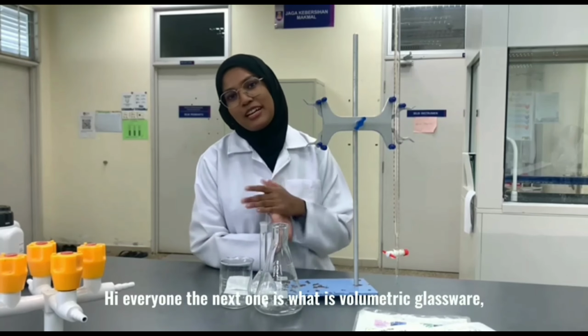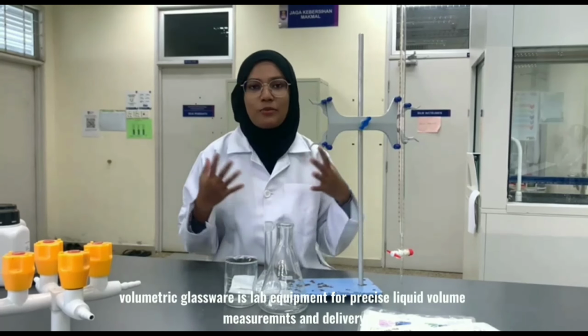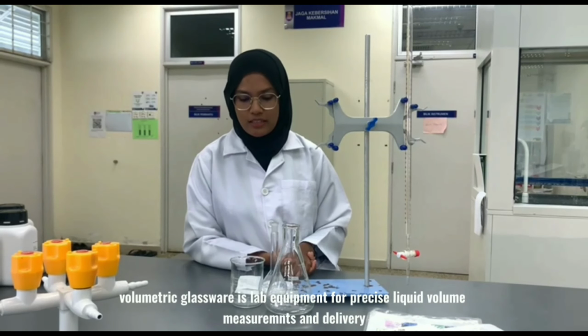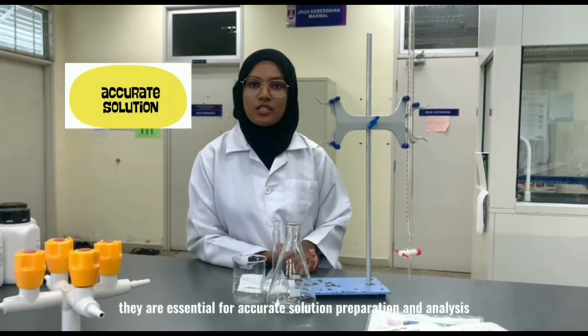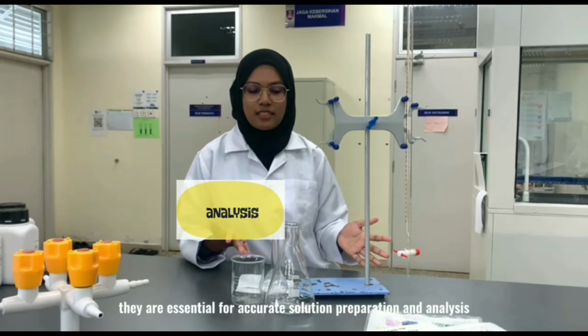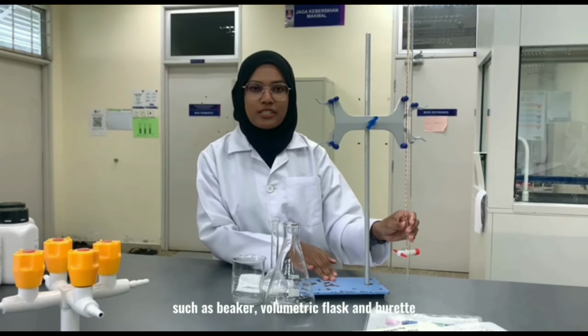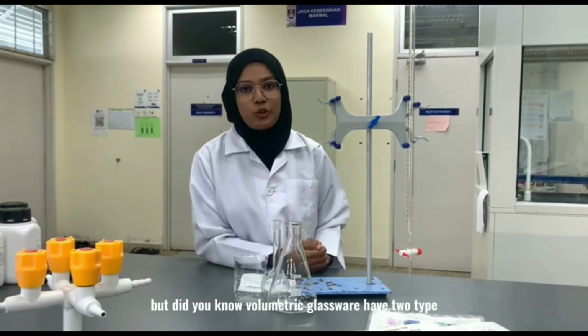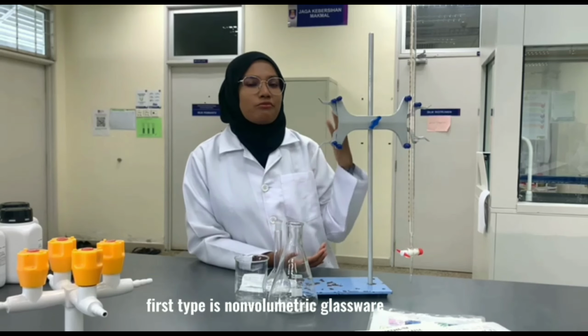Hi everyone, the next one is, what is volumetric glassware? Volumetric glassware is lab equipment for precise liquid volume measurement and delivery. They are essential for accurate solution preparation and analysis, such as beaker, volumetric flask and burette. But did you know glassware has two types? The first type is non-volumetric glassware. The second type is volumetric glassware.